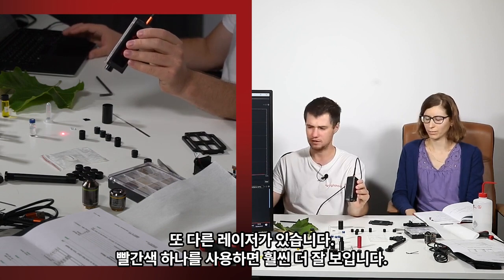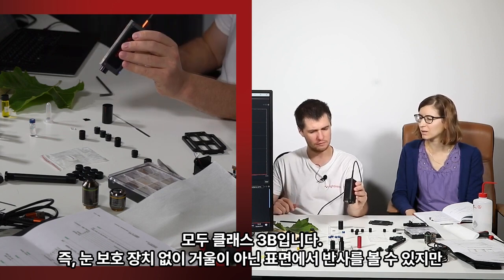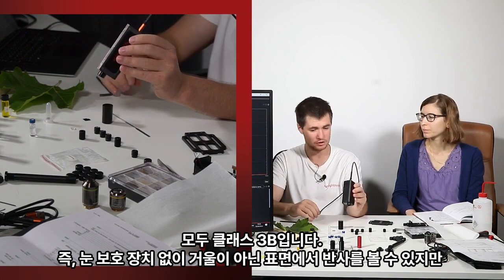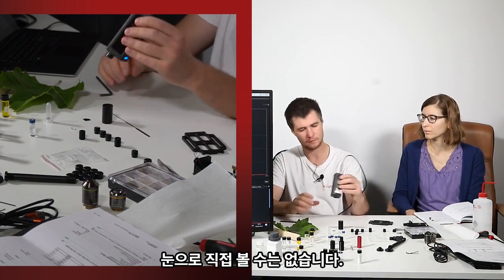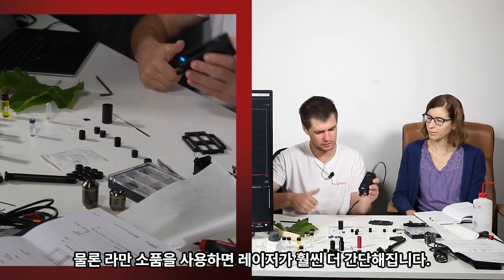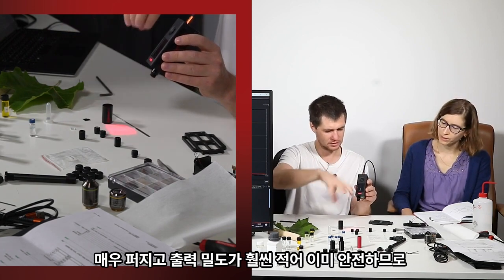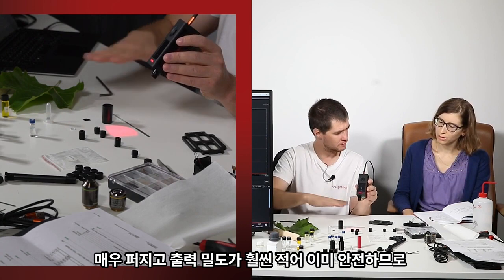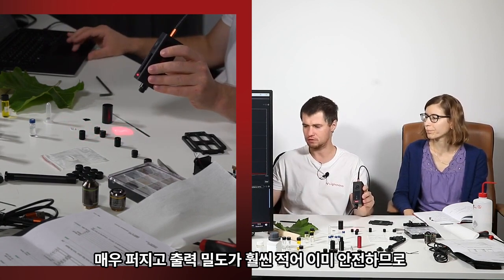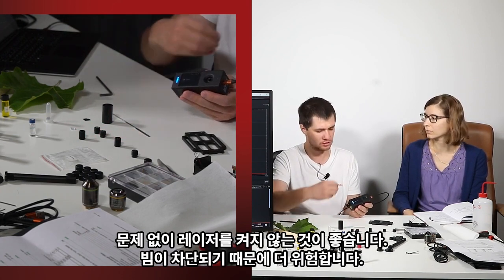There is another laser, red one, and you see it way better. They are all class 3B, which means we can look on reflection from non-mirror surfaces without eye protection, but we cannot direct into our eyes. It gets way simpler if you, of course, use some Raman probes. Then your laser beam spreads and power density is significantly less, so it's already more safe, of course. So it's recommended not to turn on the laser without the probe because it is more dangerous. Beam is collimated.